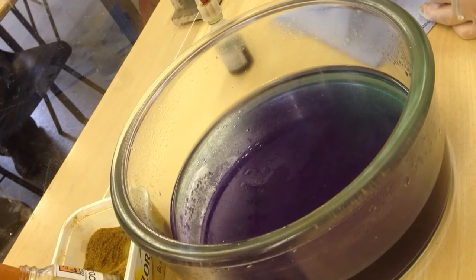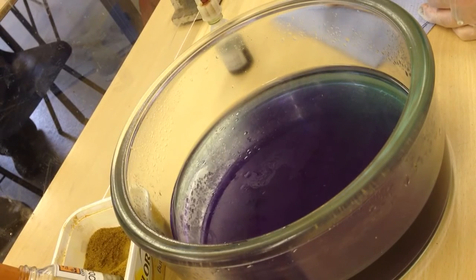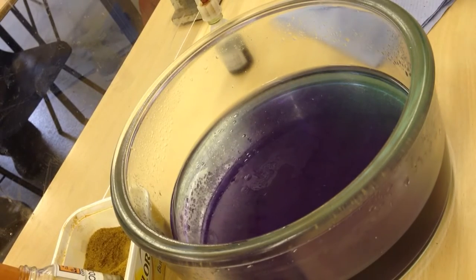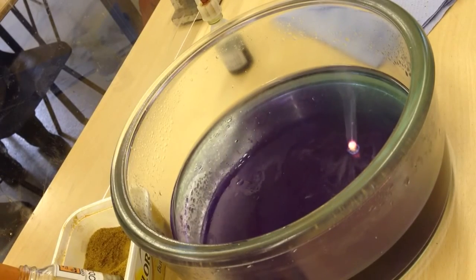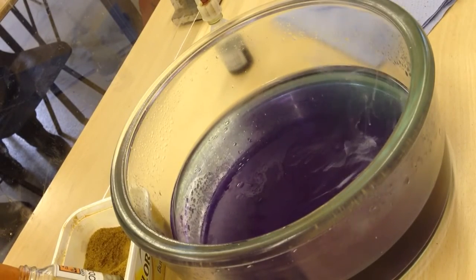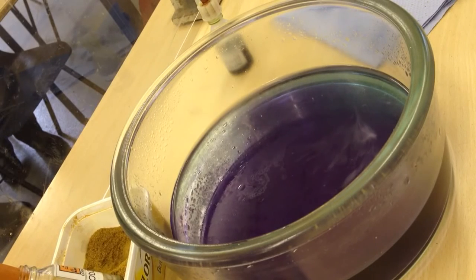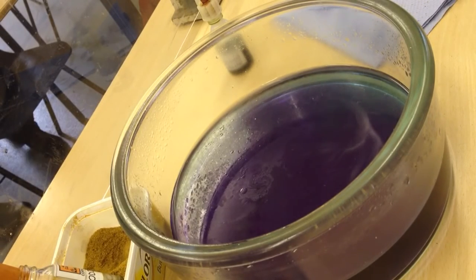Right. Double, double. Let me just tidy this up, get some of the oil off this. Right, ready for potassium again? Yeah. What are we doing? It's burning. Yeah, it does, doesn't it?